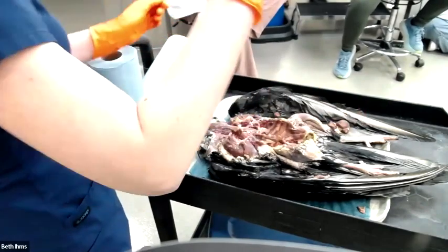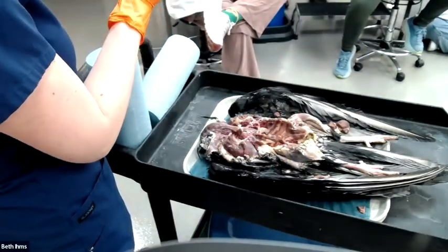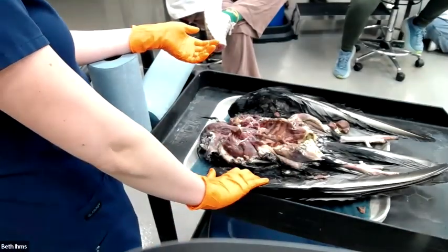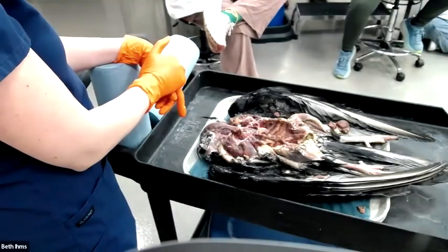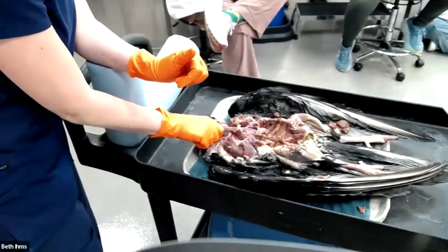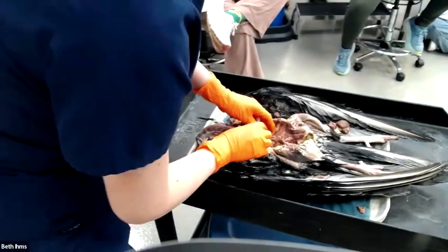So I got his toe. He did an amputation, and then the vets went back and amputated it to the joint, like they did a real job. But actually on biopsy, he did such a good job amputating his own toe that when I was looking at the two ends, I couldn't tell which was his and which was theirs. Pretty clean, yeah. All right, so cool case, not a great sample, didn't preserve well.